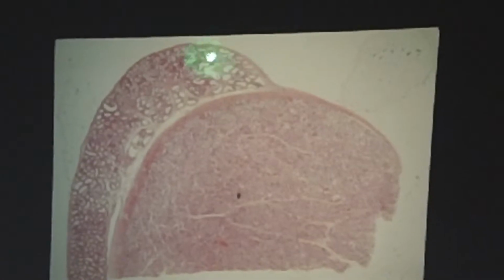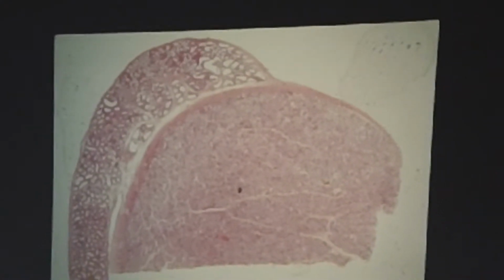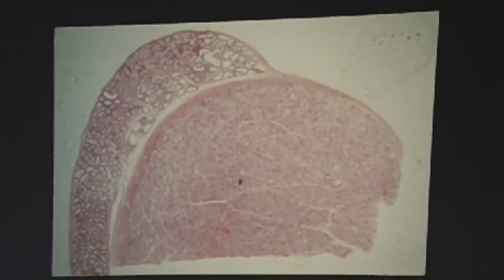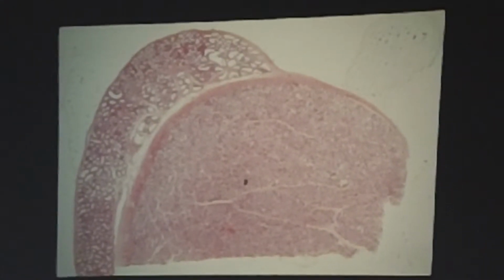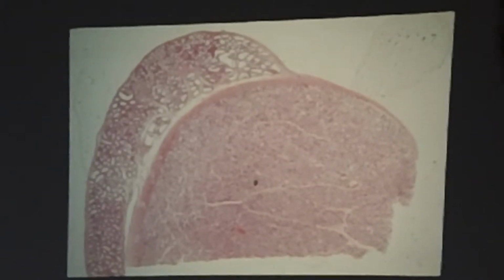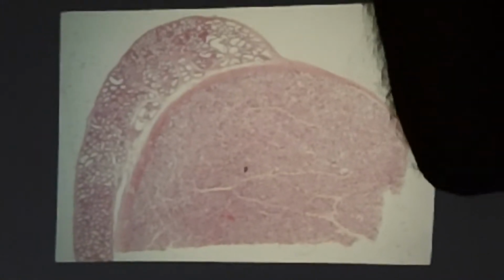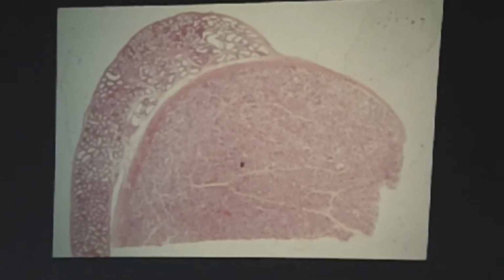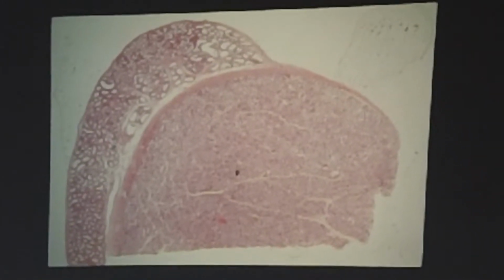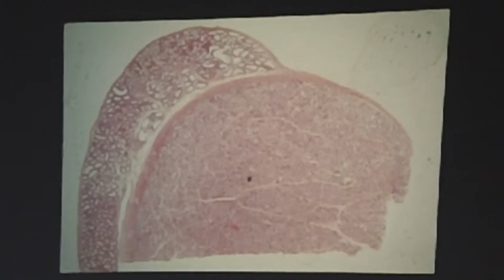These tubules up here, if you looked at higher power, you would see that the epithelial lining, the luminal profile, kind of undulates. I want you to think back to Nigel's lecture where we talked about the efferent ductules having ciliated columnar, absorptive cuboidal columnar, so that's what you're seeing. So even at a low power, you can pick out the 10 or 20 efferent ductules from the epididymis itself there.